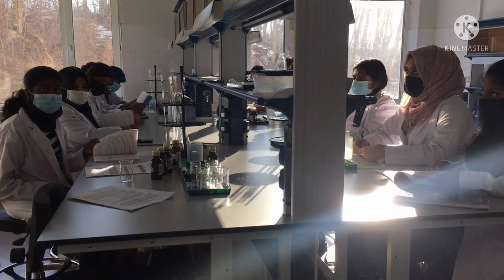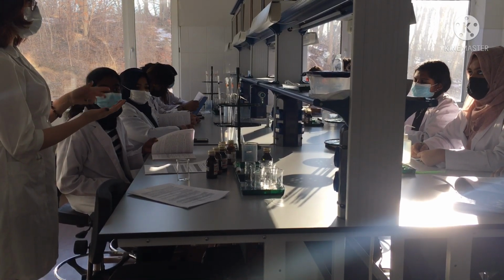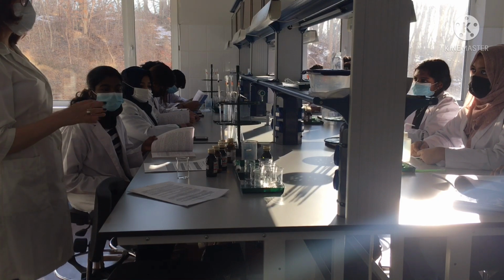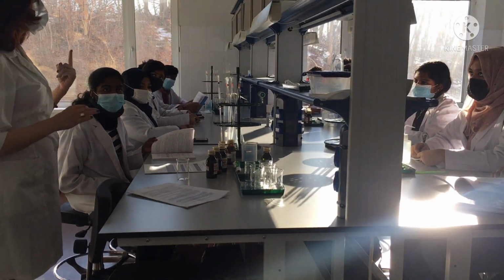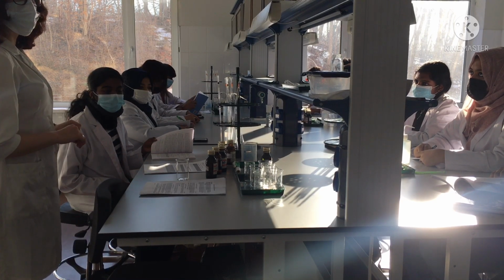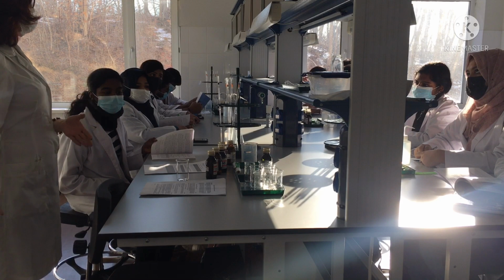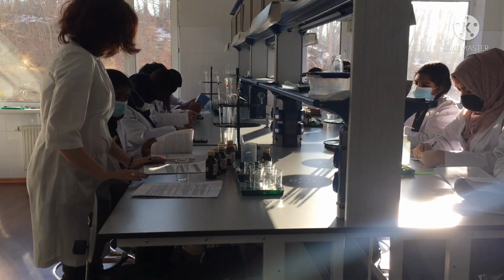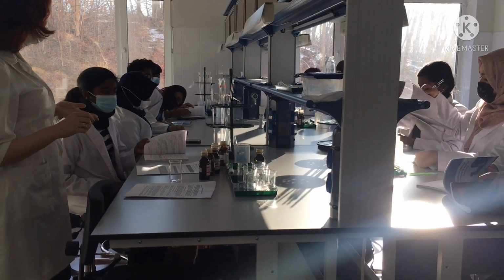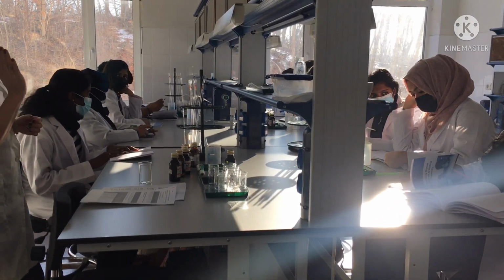One person should take a cell phone, for example, and the timer needs to be started when you add the final reagent, and you need to stop it when you see the change of color. Only one person should measure the change of color, because we have different components, and only one person should each time decide when the color is enough and the reaction is finished. That is important. Okay. Prepare your notebooks where you will write down the data. One person should write down the data, and one person should give us the timer. Decide who will estimate the time of reaction.